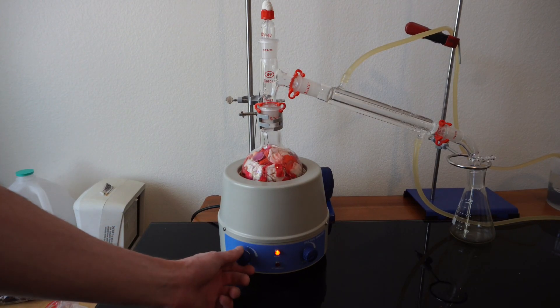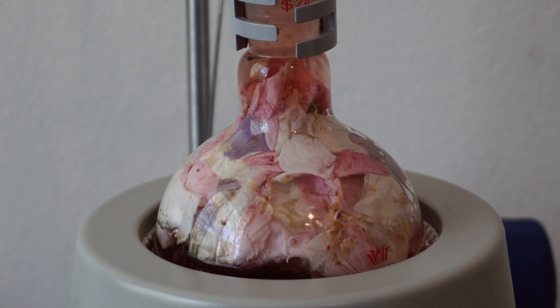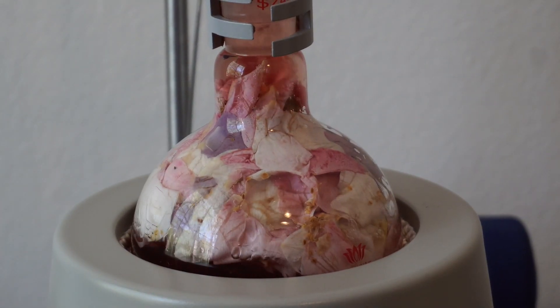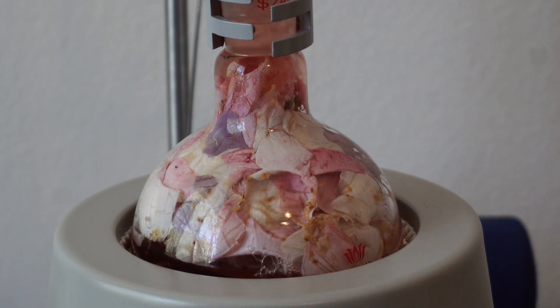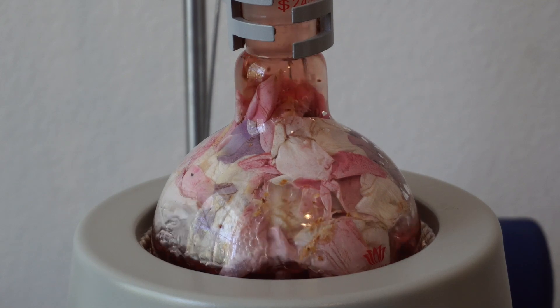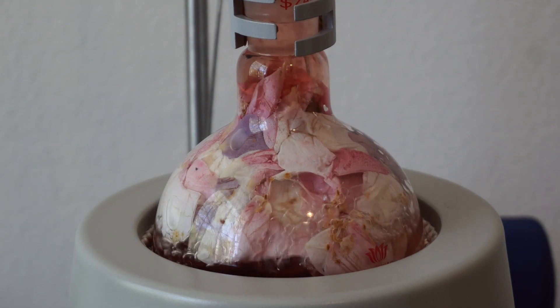Unfortunately, I didn't get much on camera, however, my roses were being pushed up into the neck of the flask, which caused an overflow, which made me stop the distillation, remove the stuck flowers from the neck before proceeding. This could have gone really bad, though luckily I was able to catch it in time, however, I will have to add additional filtering steps in the next process.